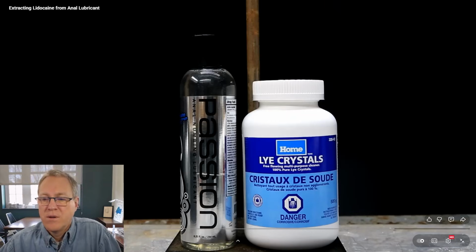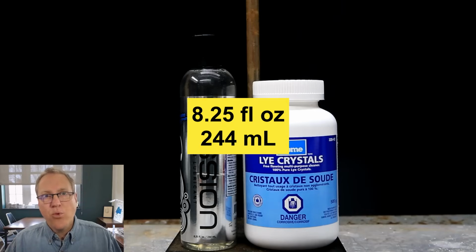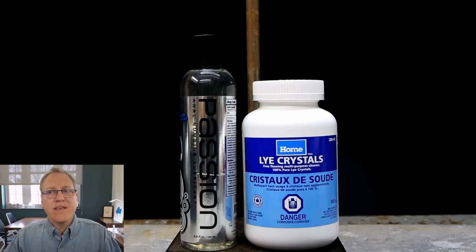Nicely enough, the only chemical that's required for the extraction is sodium hydroxide. Now, before we leave this image, I don't know if you can see at the very bottom of the image, it might be kind of blurry, that is 8.25 fluid ounces or 244 milliliters. So that's the amount of material in that bottle of this lubricant.